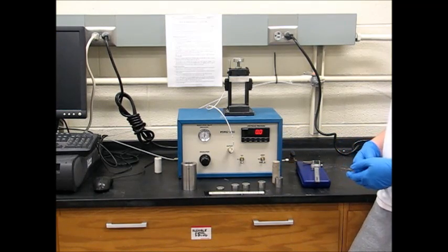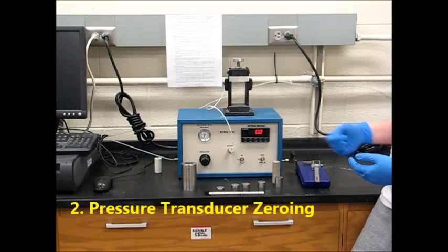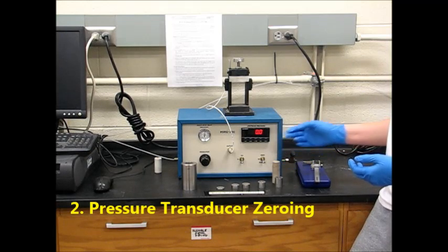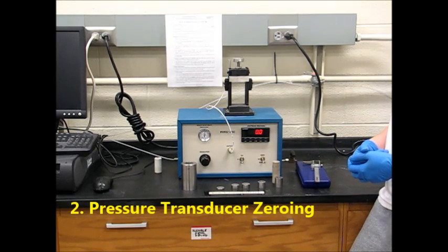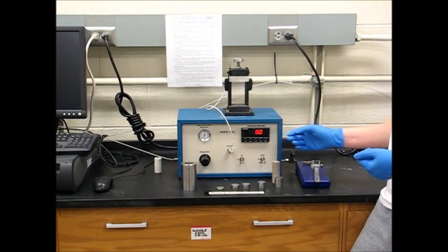The next thing that we're going to do is zero our pressure transducer. We're going to turn off our helium source, open valve 1, and then turn valve 2 to expand, and that will open the matrix cup. The pressure reading on the digital reading should be showing 0. If it's not 0, repeat the procedure to make certain that all the pressure has been released. If the readout value has decreased but is still not 0, adjust the 0 adjustment screw until a 0 reading is obtained. Since ours is already 0, we'll move on to the next step.